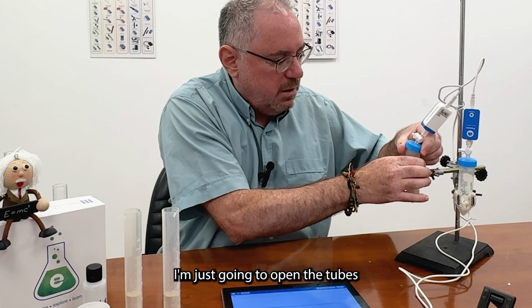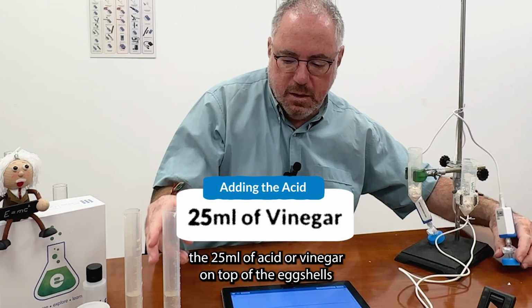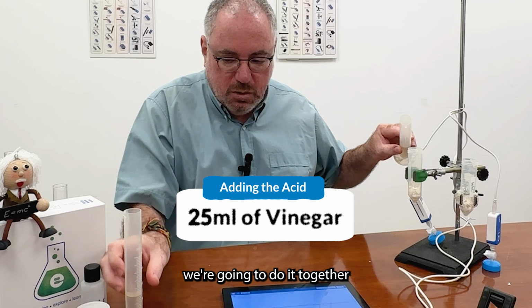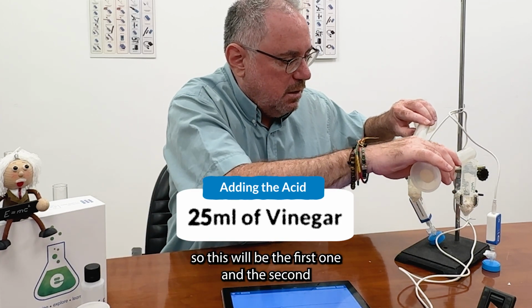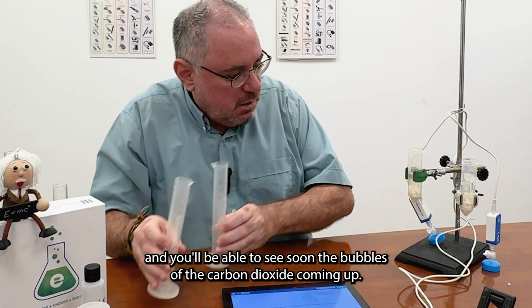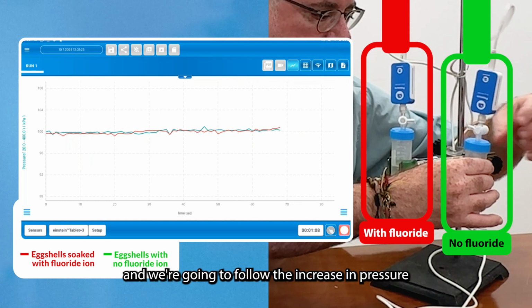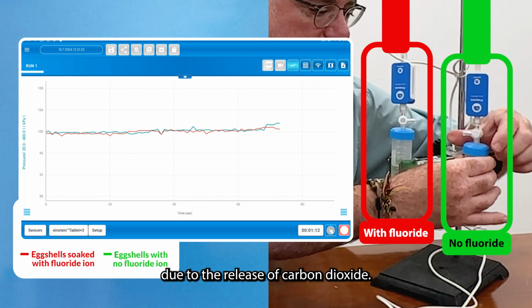I'm just gonna open two tubes and I'm gonna pour the 25 milliliters of acid or vinegar on top of the eggshells. We're gonna do it together. So this will be the first one and the second, and you'll be able to see soon the bubbles of the carbon dioxide coming up. So we're gonna close it very, very quickly. And we're gonna follow the increase in pressure due to the release of carbon dioxide.